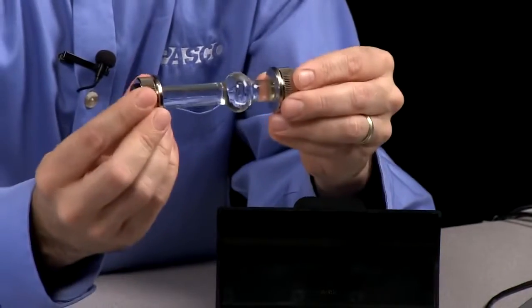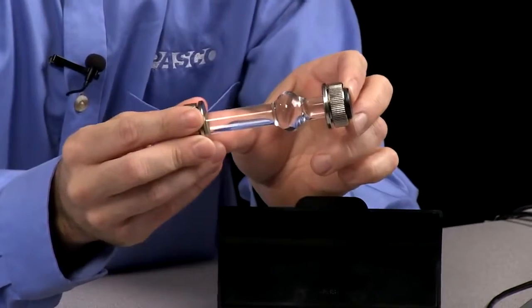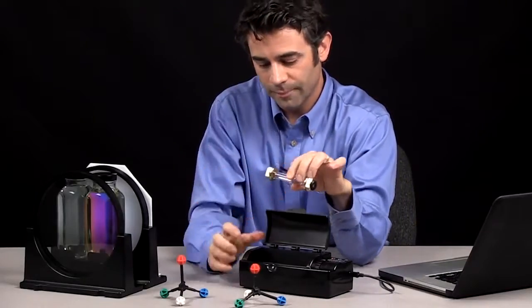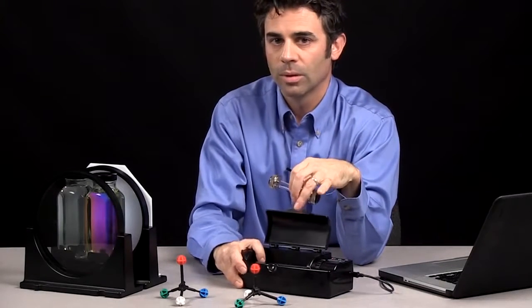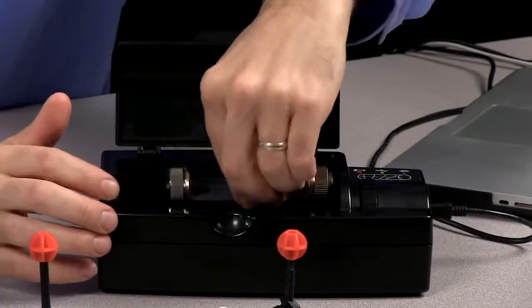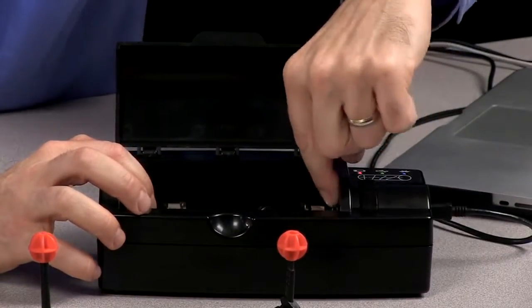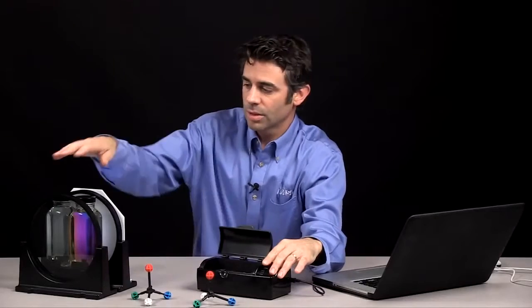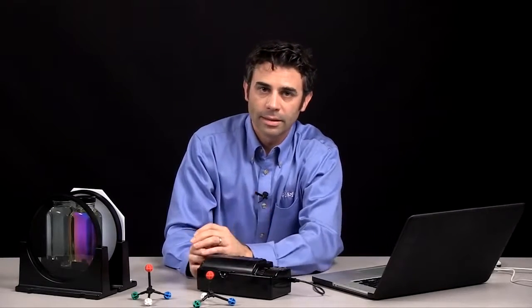So this sample cell just has water in it, but it's a 100 millimeter sample cell with quartz ends, so it won't affect any of the light. In the polarimeter, there is a 589 nanometer monochromatic light going through a polarizing film on this end and a polarizing film on this end in front of a detector that I can rotate around just like I could rotate this around. So I have monochromatic light that's getting plane polarized, going through my sample, and hitting a detector.